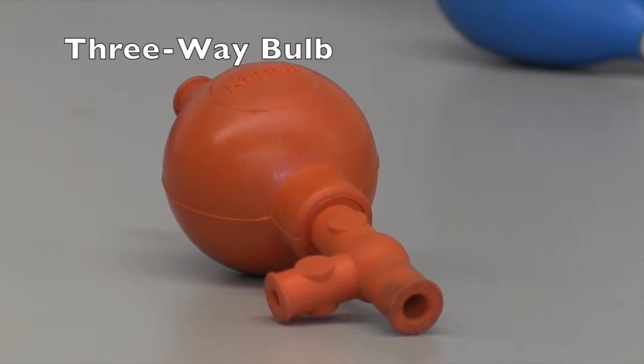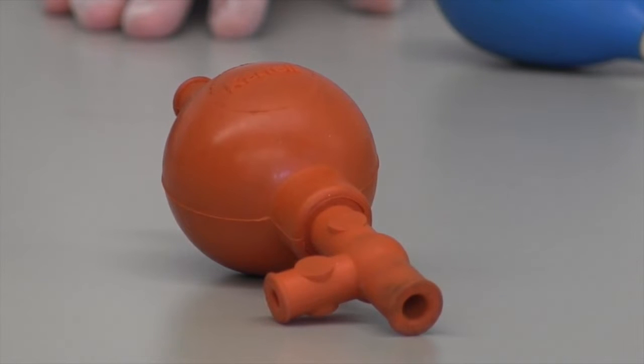The third option is the three-way bulb. For accuracy and simplicity, this is the best option. Today, we will be taking a closer look at this bulb and showing you the best method for using it.